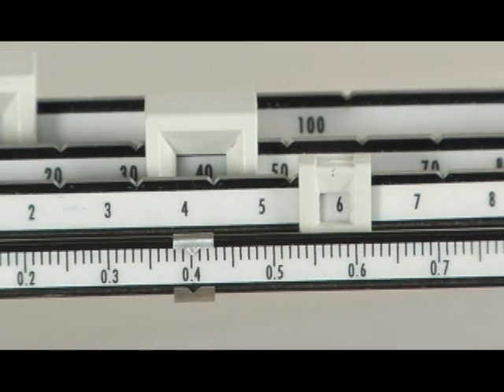By my estimation I would say about a tenth of a spot. So this mass would be 46.401 grams.